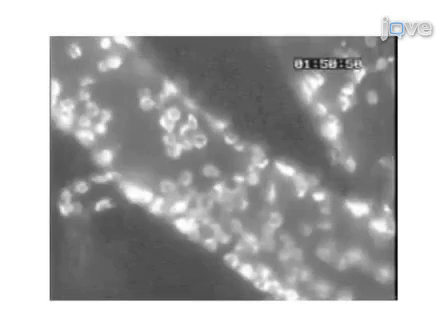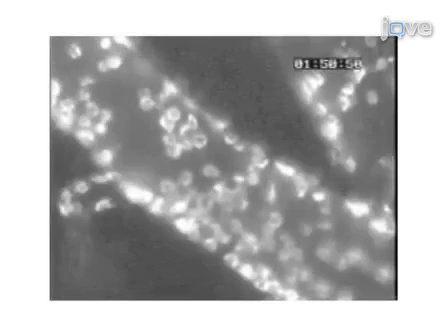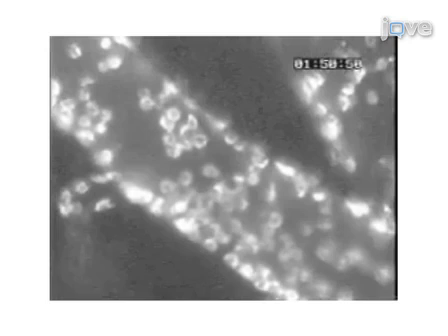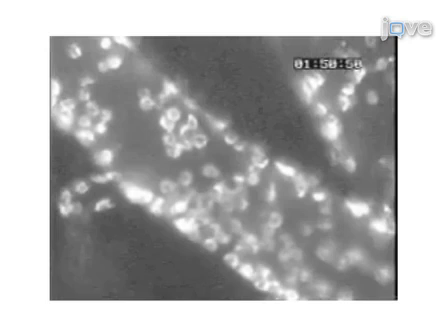The final step of the procedure is to perform intravital analysis of leukocyte and platelet adherence in the pial vessels via fluorescent-labeled specific antibodies.